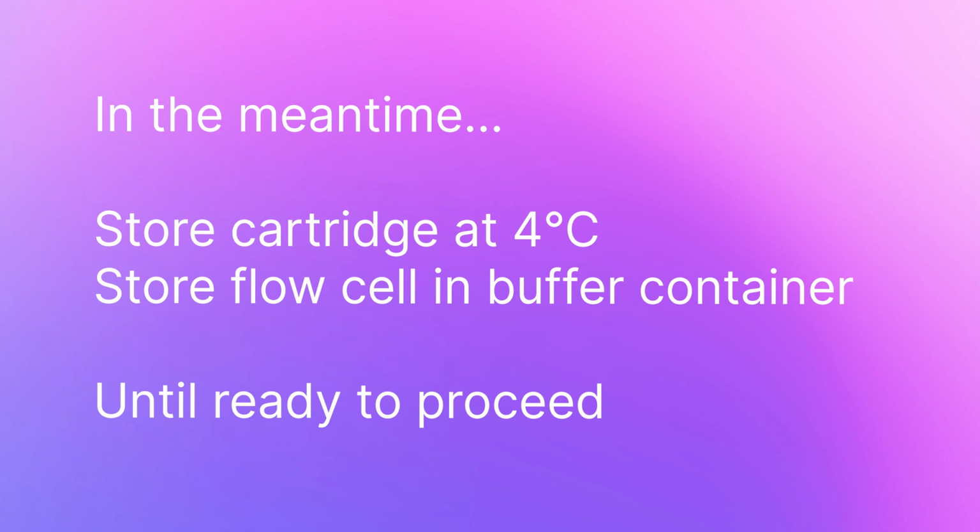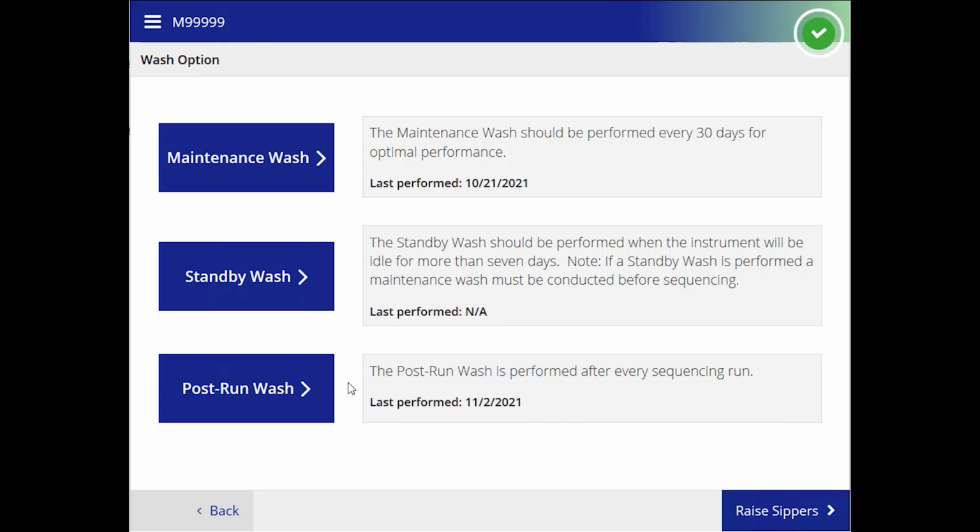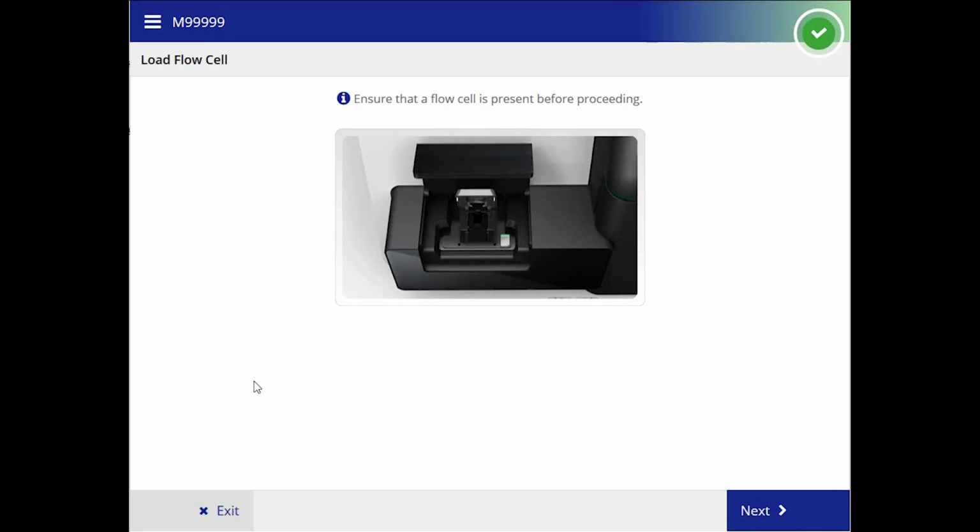Store the reagent cartridge at 4 degrees Celsius and the flow cell in the buffer container. Then, prepare a fresh wash solution and perform a post-run wash. The post-run wash is needed to start the next run.